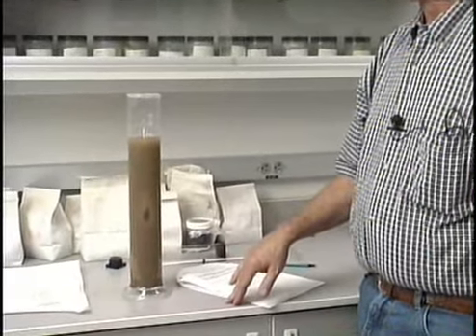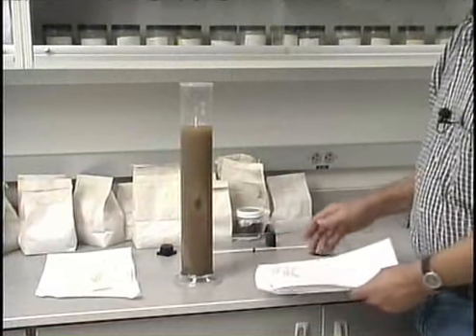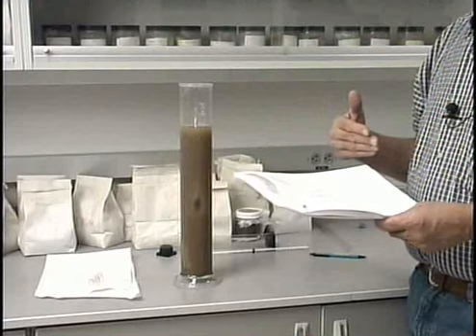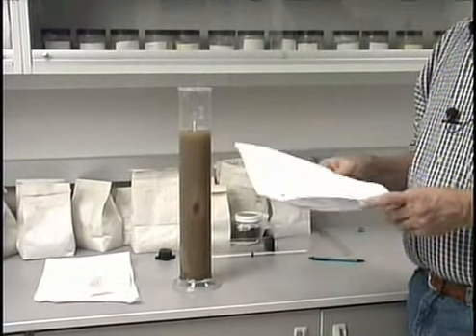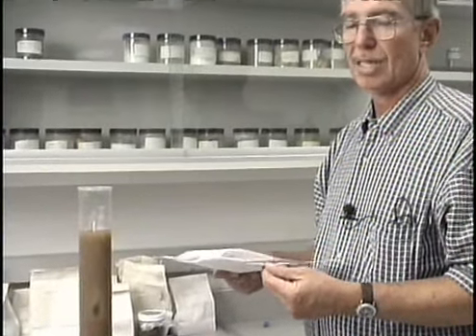Now, this was a little bit deceptive, because in looking at the sedimentation here at the bottom, it appeared that we had quite a lot of sand, not very much silt, and I expected there to be quite a bit of clay in this soil, but in essence, the difference between the 40-second reading and the 120-minute reading is basically the content of silt. And without actually doing the calculations on page 16, which I'm going to be asking you to do, I would like you to take the data that we've generated in this lab from this soil sample on page 15, plug it into the formulas, and generate the percent of sand, the percent of silt, and the percent of clay.